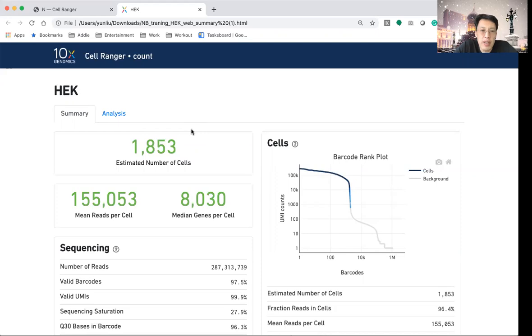After that, we will generate a file like this. Let me go through a few key points we want to look at in this particular file. The first one is the estimated number of cells. As you can see, in this case, it's about 1,800. Sometimes in most of the experiments, we'll aim at 10,000. But this will let you decide how many cells we really identified in this particular experiment.